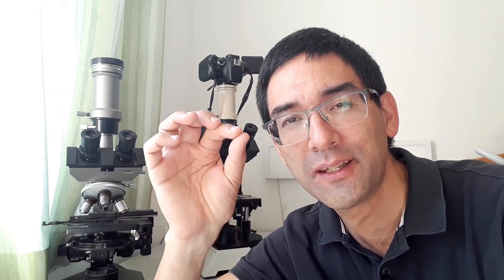So hi, today I'm going to put the wing and the stinger of a small parasitic wasp under the microscope. You think it sounds crazy? Well, stay tuned, I think it's going to be quite fun.